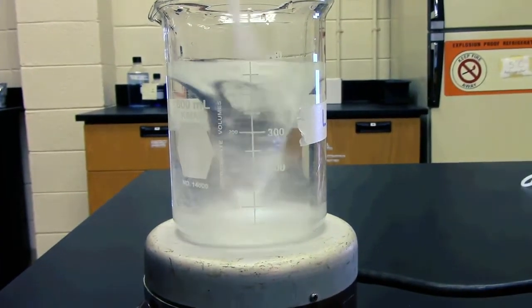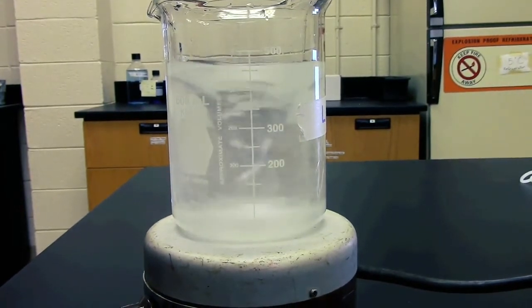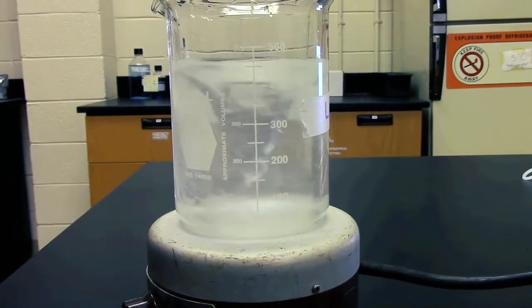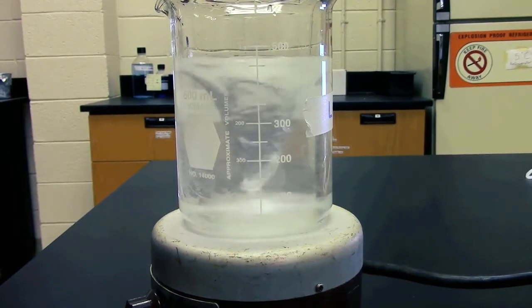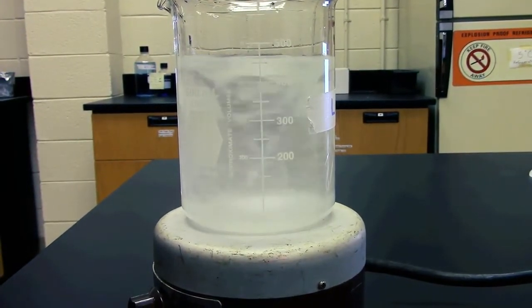For this next step, if you are planning on adding a solute to the liquid, add in the powder slowly while the stir bar is already spinning. If you put in the powder before turning the device on, it won't mix in well.